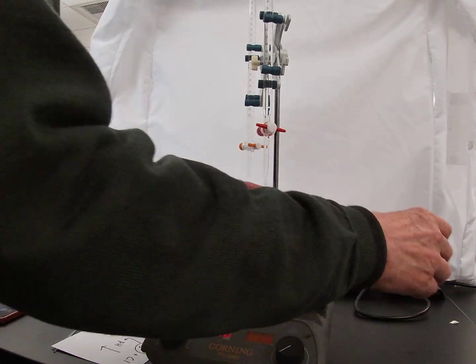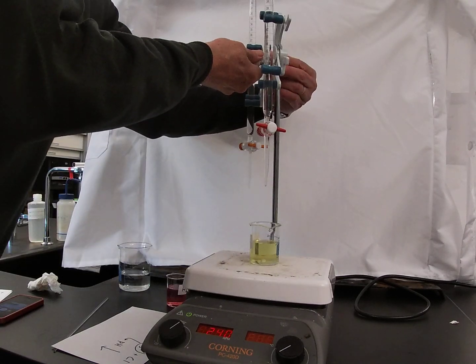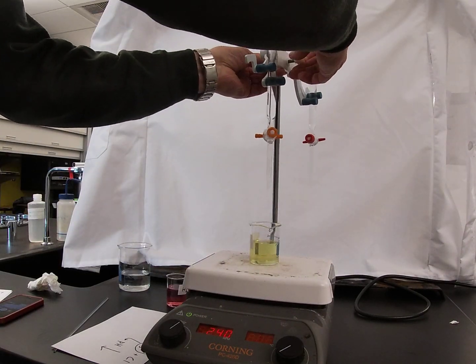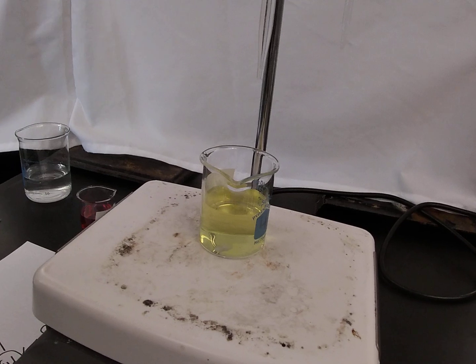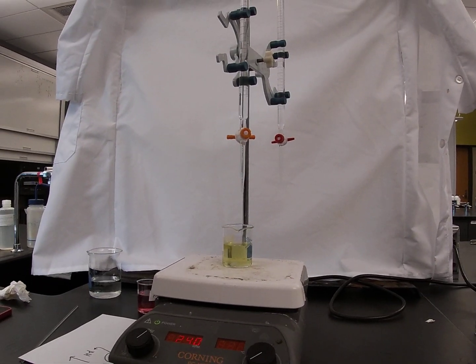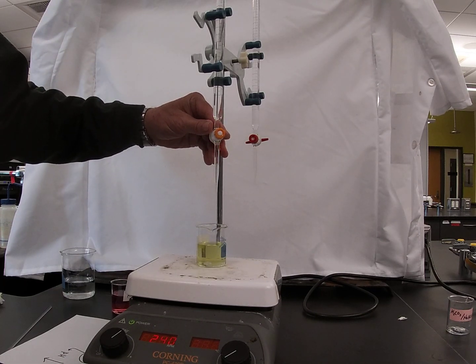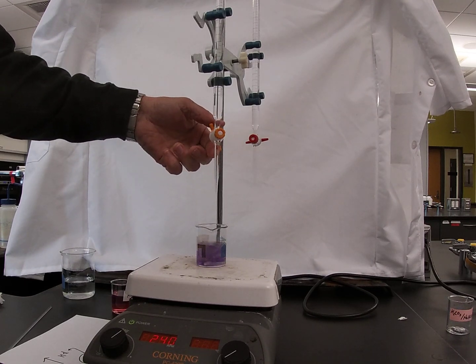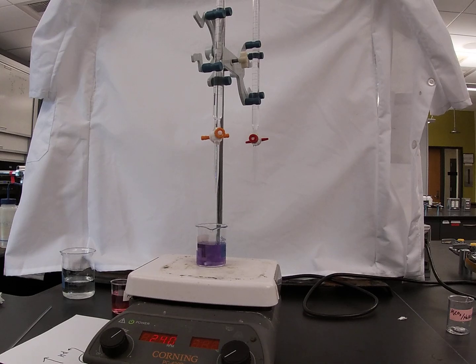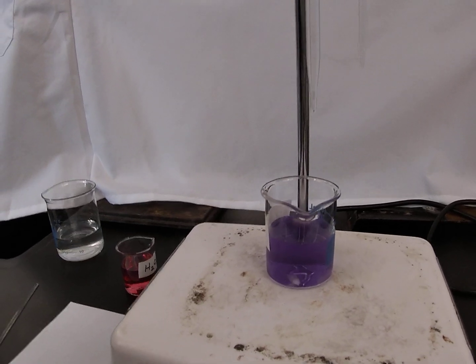We can try that same experiment, only this time using a strong base, sodium hydroxide. Same experimental setup, same starting pH, the green tint to the solution indicating essentially neutral conditions. And here as I start a very slow drip of sodium hydroxide into the beaker containing DI water, 3 drops, 4 drops, 5 drops, and you note how the solution has quickly turned purple, indicative of strongly basic conditions in that beaker.